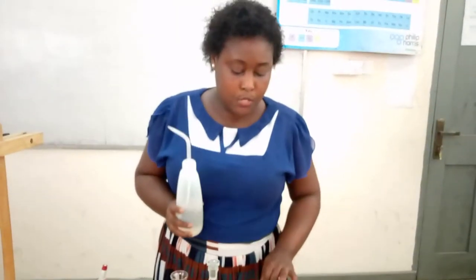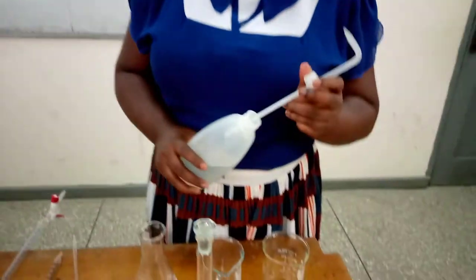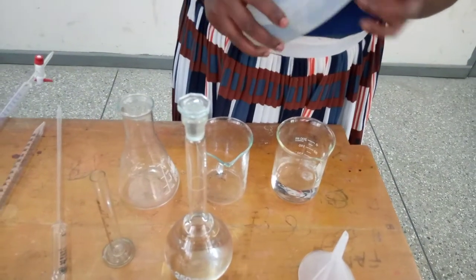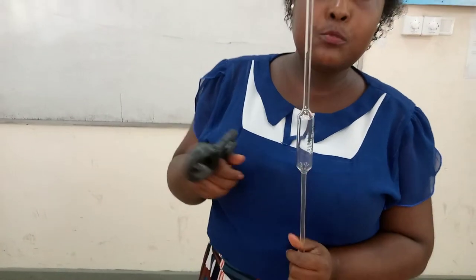This is my distilled water. I'm going to clean it by first rinsing it with distilled water. If you don't have distilled water and have deionized water, you can use it. You pour a little amount of the distilled water into a clean beaker. I have here with me a pipette bulb — that's what is going to aid me to draw the water. I'm going to fill the water up to just the lower part of the expanding region. You don't need to fill it to the calibration mark, just a little bit lower at the expanding region.